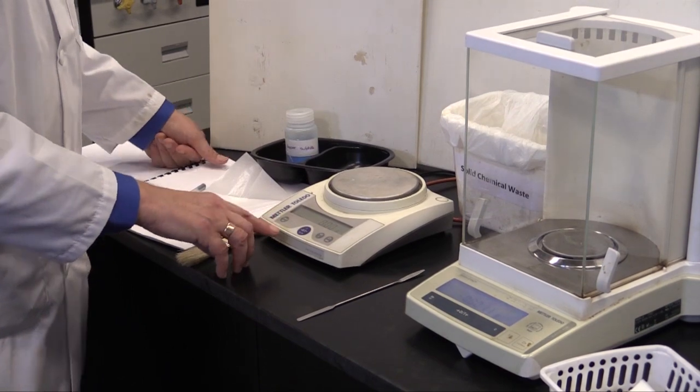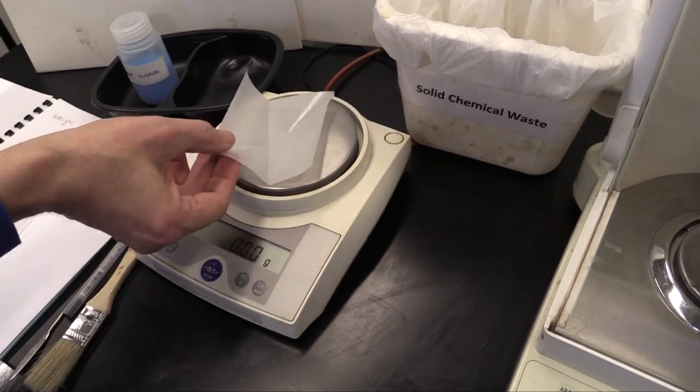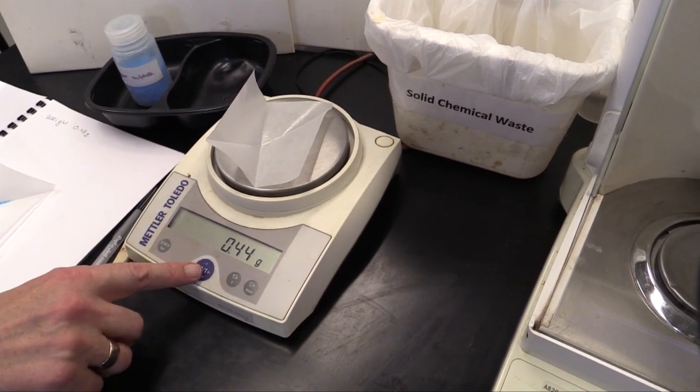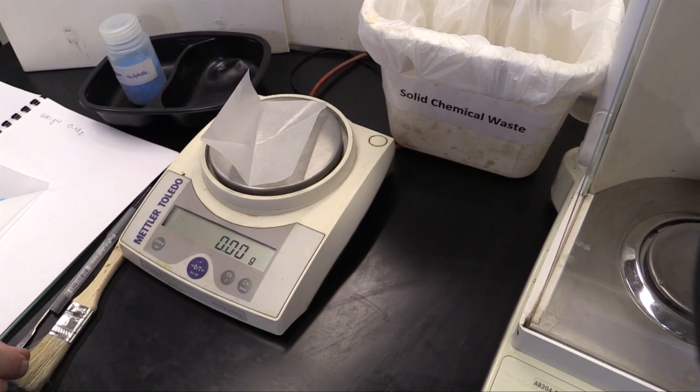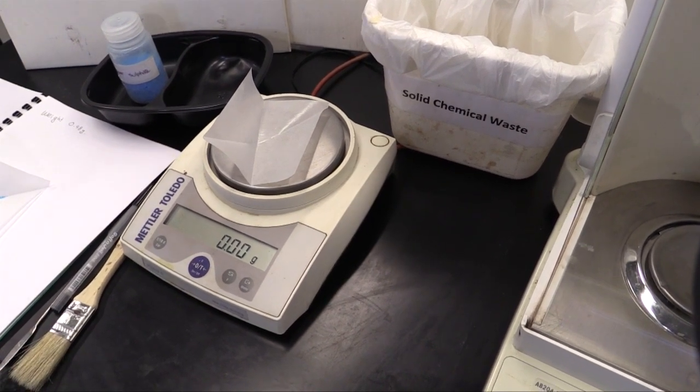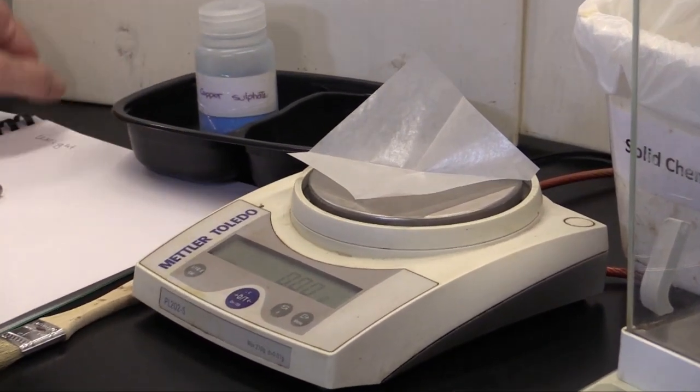If you look at the display here, it presently reads zero, but when I put the weighing paper on, I get a number. Now I push this large button here, tare, which means set that to zero. Once we have done that, it's time to weigh out.